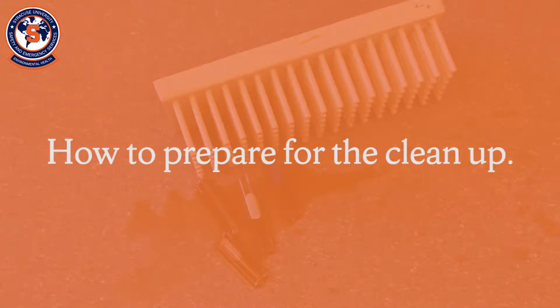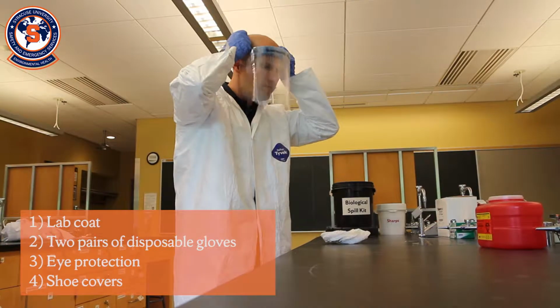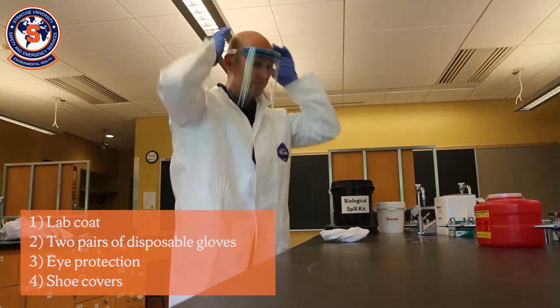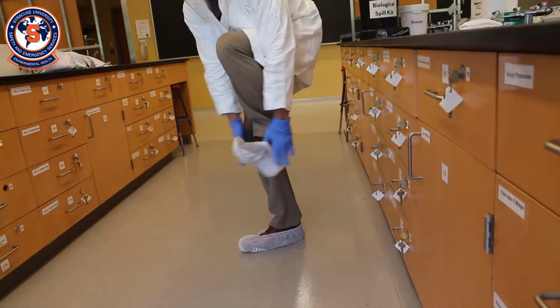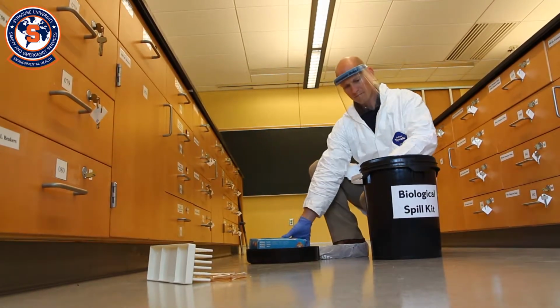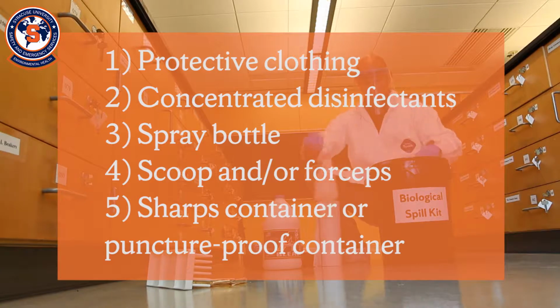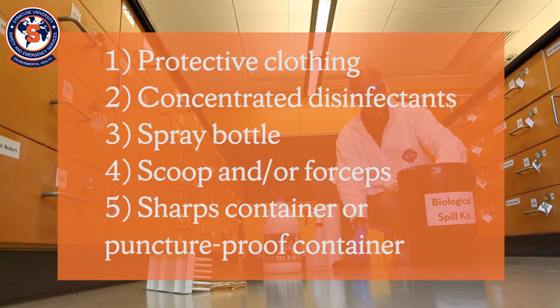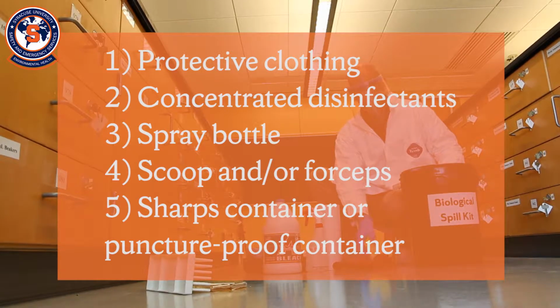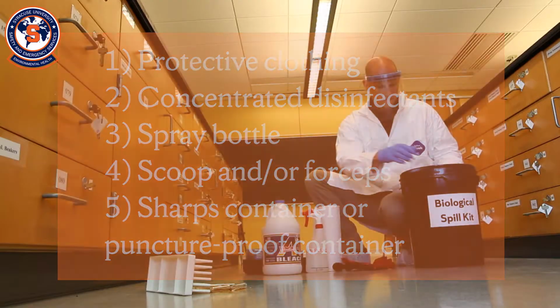Before beginning the spill cleanup, ensure you have donned the appropriate protective equipment. At a minimum, you will need lab coat, 2 pairs of disposable gloves, eye protection, and shoe covers. Prepare to clean up the spill by assembling your spill cleanup materials located in your lab. A basic biological spill kit may include protective clothing, such as a disposable lab coat, gloves, face protection, and shoe covers, concentrated disinfectants and a spray bottle, absorbent material such as paper towels, scoop and/or forceps, a sharps container or puncture-proof container for disposal of sharps or broken glass.